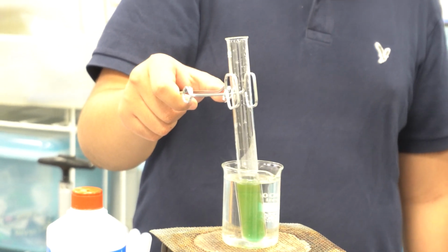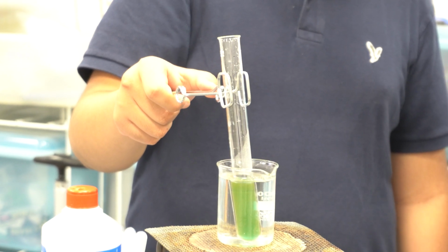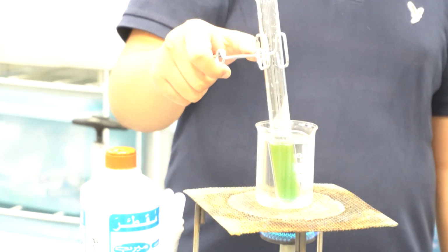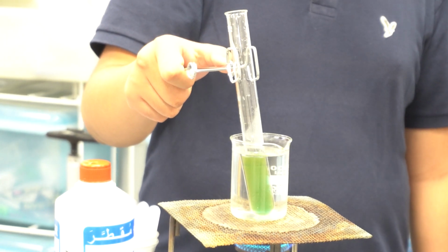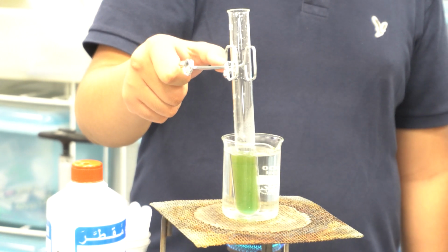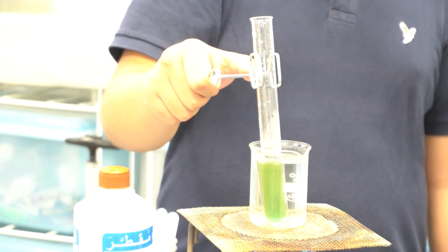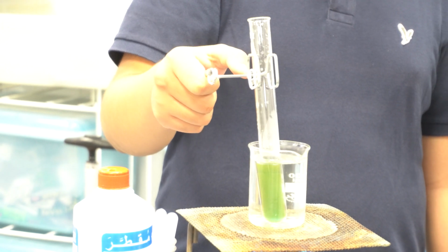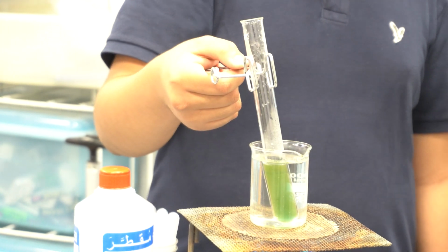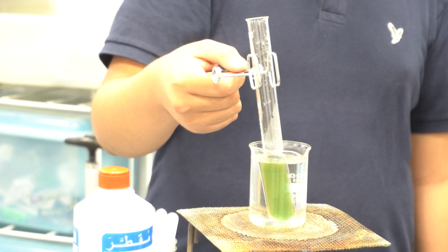So Abdulaziz is still holding the test tube using the tongs, and we are using a water bath for safety. And as you can see here, the color changed from green and is now starting to become yellow. Even if we give it a little more time, it will be converted into orange, as you will see. Of course, the intensity of the color is related to the concentration of the sugar. If the sugar concentration is more, the intensity of the color will be more. Exactly.